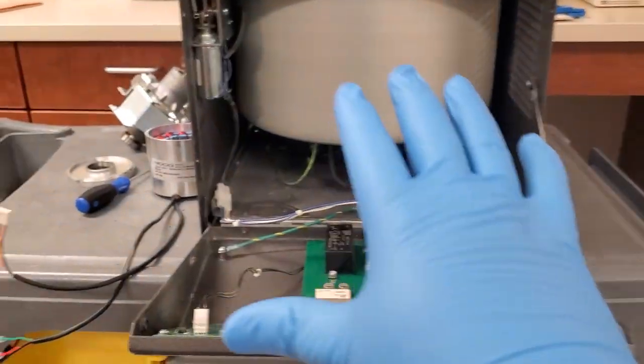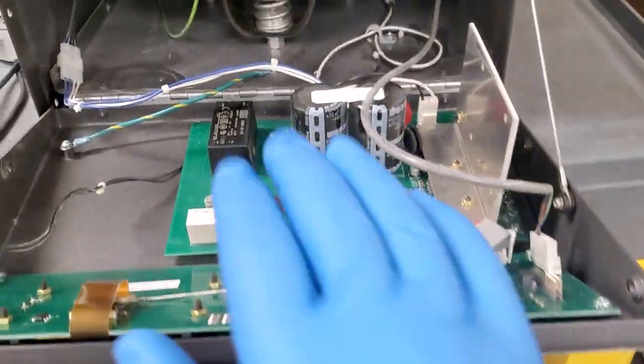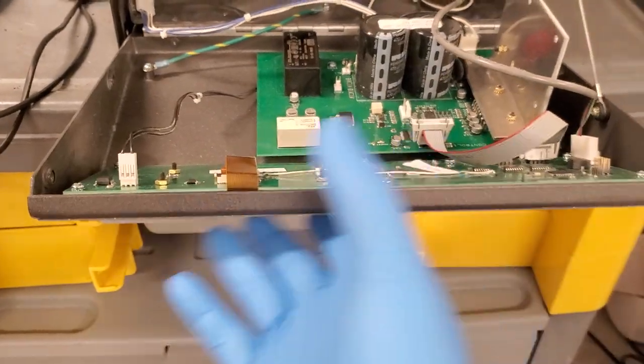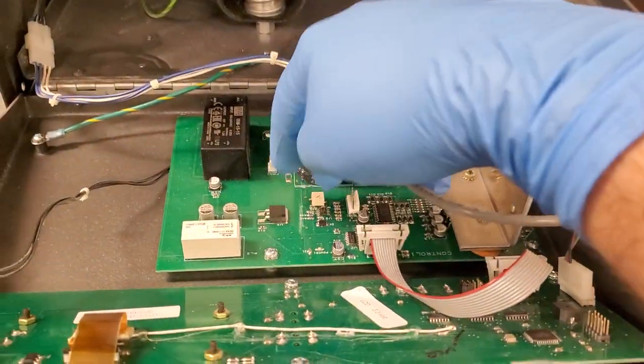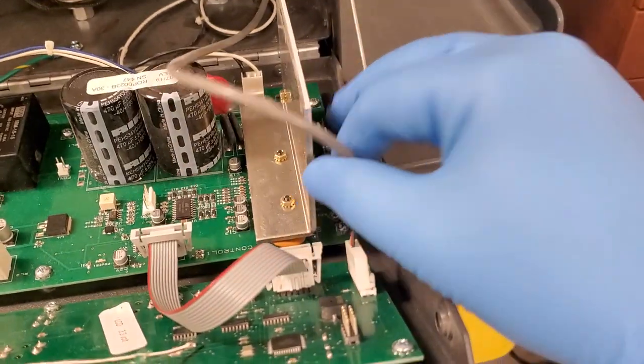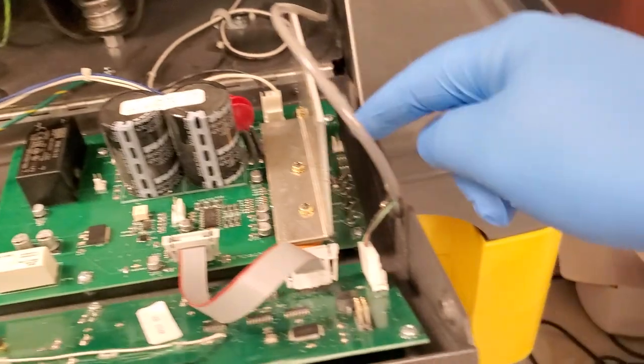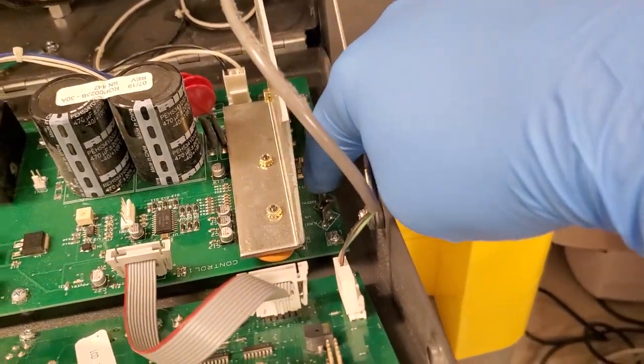All right, first off, I've got the motor out of the centrifuge. You can see this here is just the front faceplate. It's an interface board. This back here is both a power supply, because you have mains that comes into it back here, the black and white. And right here, you can see the three terminals for your motor output.